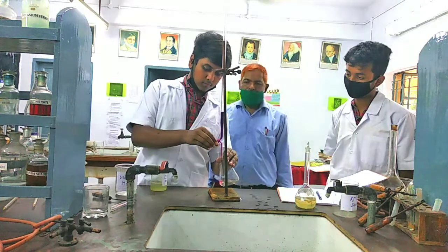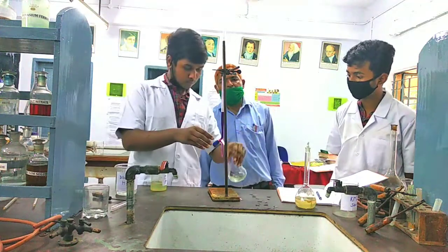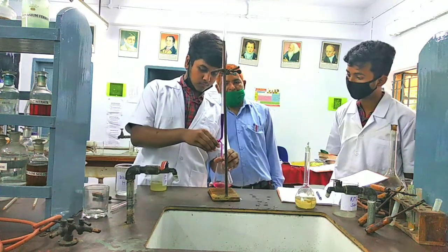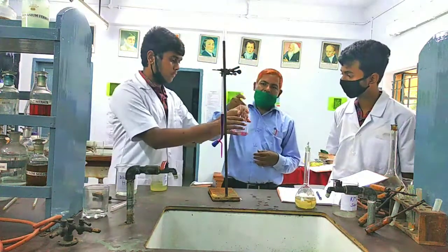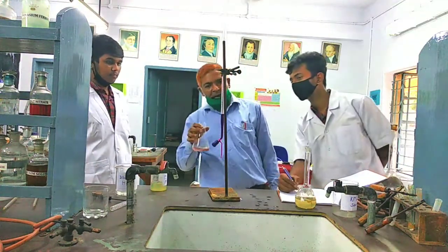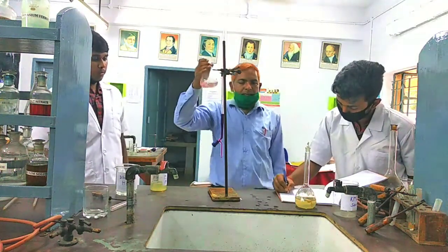Final is approximately 49. Correct observation, 48.8. Difference 2.8.